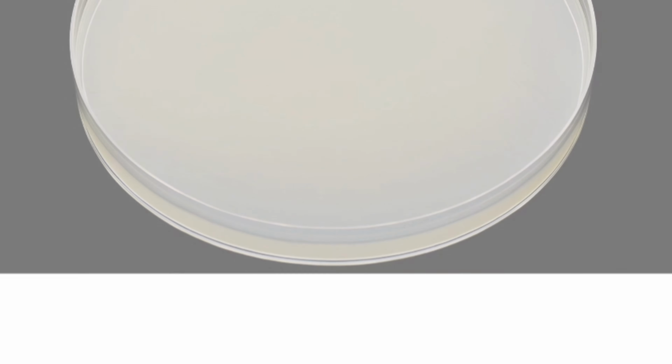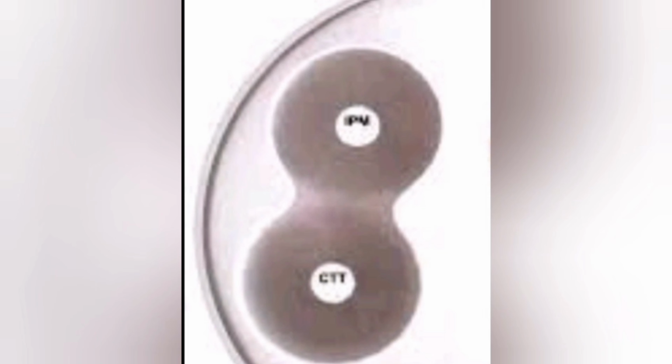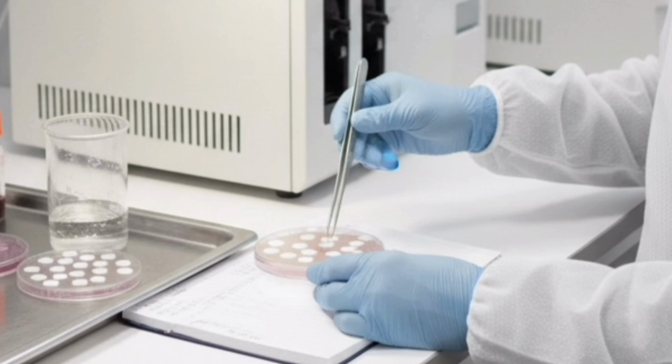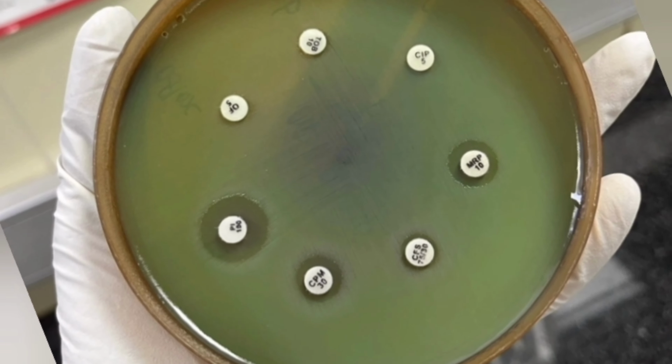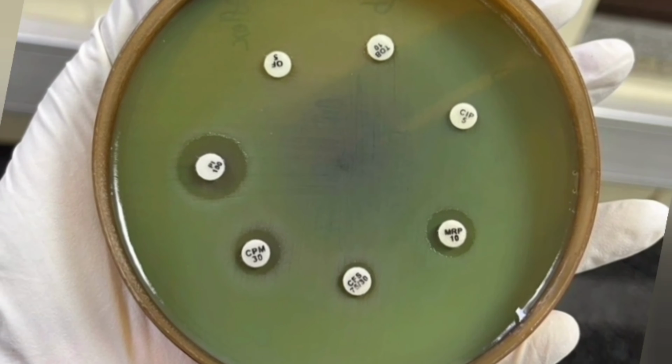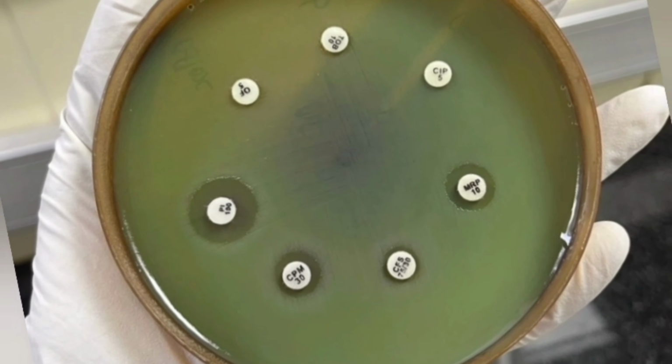Using thick or thin agar: thick agar gives smaller zone size and thin agar gives larger zone size, so always be careful with the agar depth. Placing the antibiotic discs too close leads to overlapping of zones and gives false results. Never touch the disc with fingers, this can lead to contamination. Reading zones where faint growth is noticed, so always read the disc which has correct, clear, visible edge growth. And that's how we make antibiotics speak the truth. Because every zone of inhibition isn't just a circle, it's a clue that saves a life.